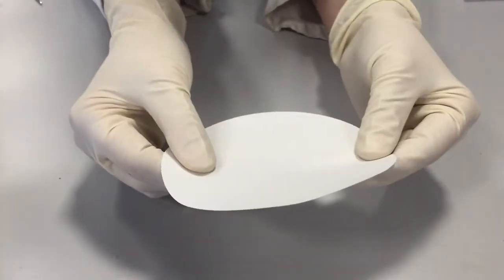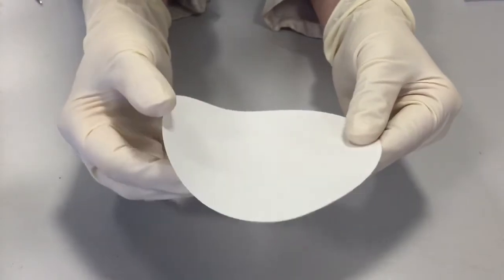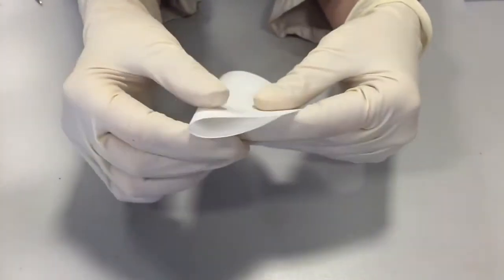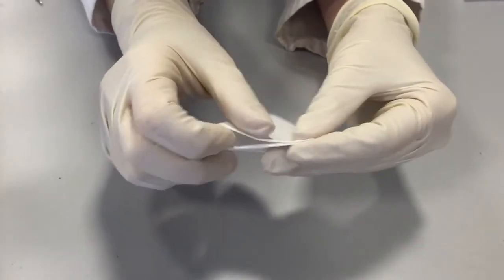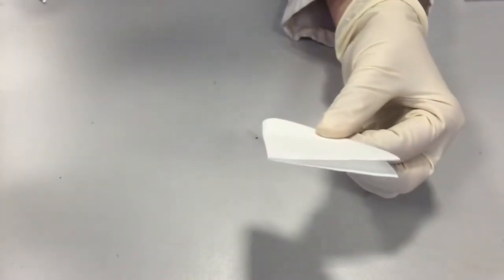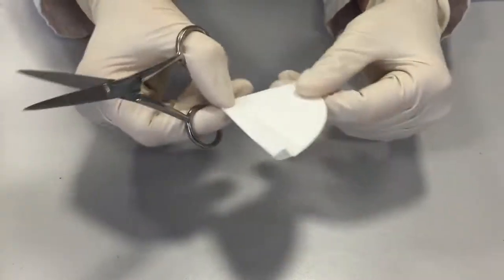So to prepare the flags for the oxygen flask analysis, you take a size 41 filter paper, ashless, fold it into quarters, make sure the quarters are equal, and take a clean pair of scissors and cut it as shown.